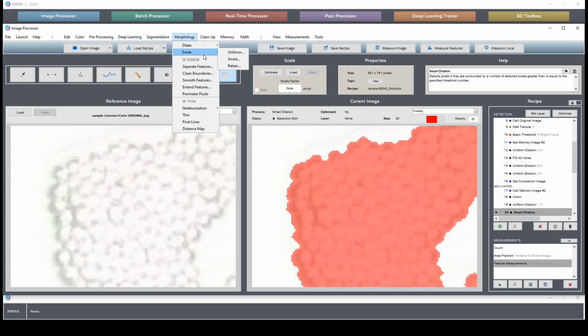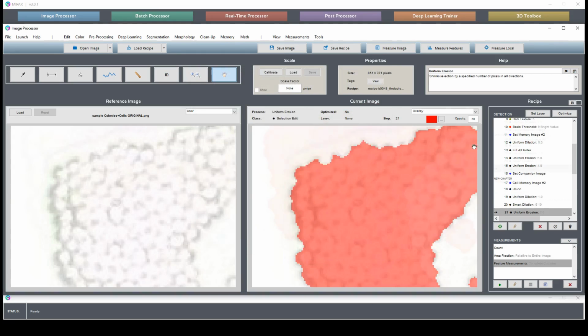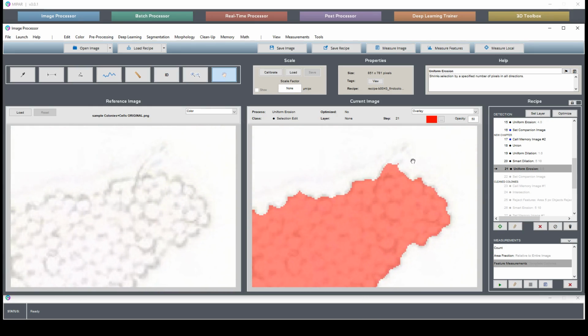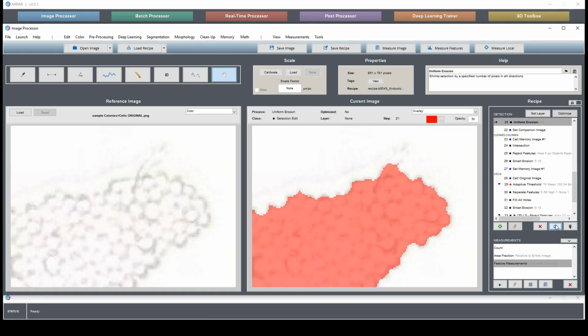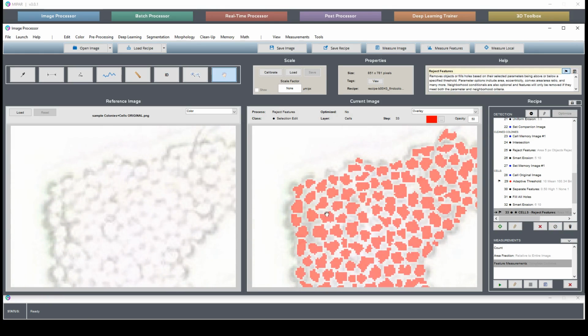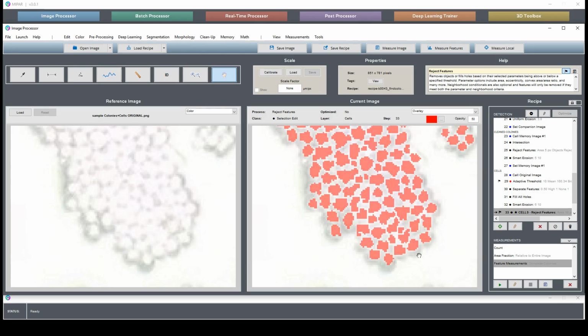And we can erode away. Erode uniform 3. So we've eroded by 3. And we'll do a tiny little piece like that. It needs to be cleaned up. Well, actually, that will all get cleaned up here in our subsequent cleanup steps that we had before. So if I enable, and we'll look and see what our cells look like now. Much better. We don't have this cell found here on this concave border. This whole boundary looks really nice.